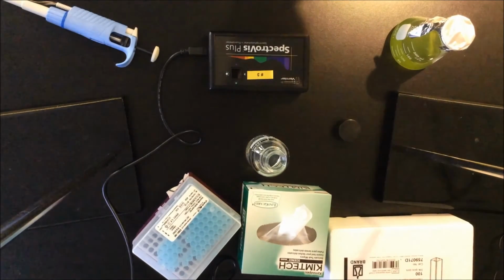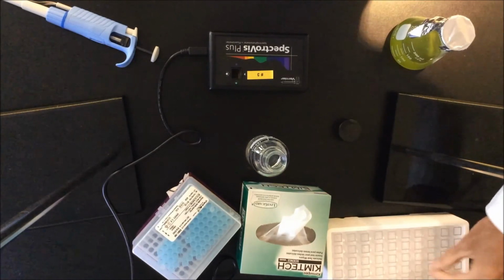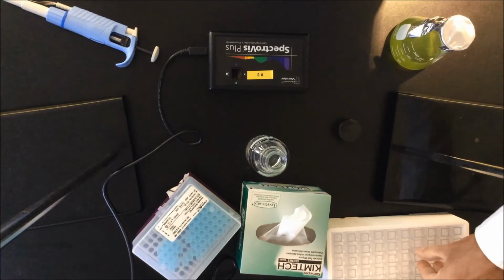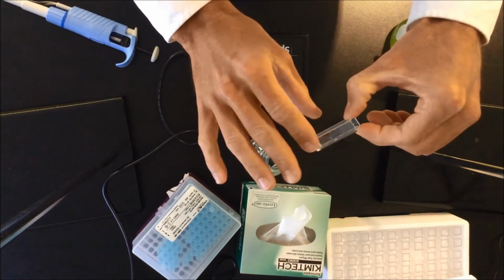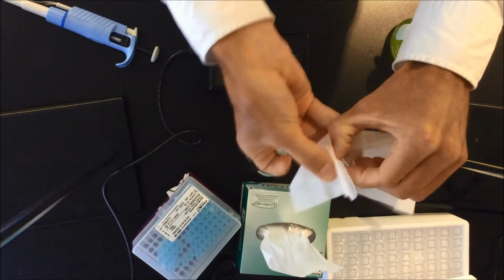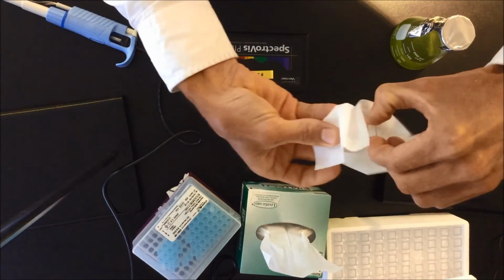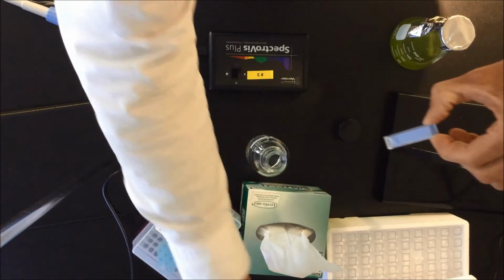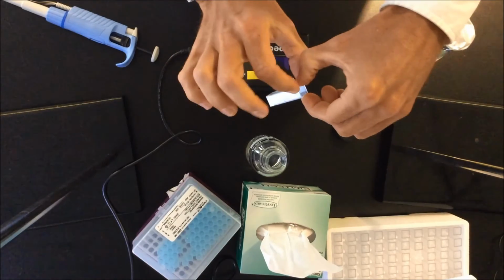Okay, let's review a few steps here on how to measure the absorbance. You're going to take a micro cuvette. Now be careful not to put your fingers on the side. The grease from your fingers can alter the side. You can actually even take a wipe here, even if these are brand new, clean and sterile. You're going to clean them, all right? Now do not put your fingers here when it's been cleaned, all right?